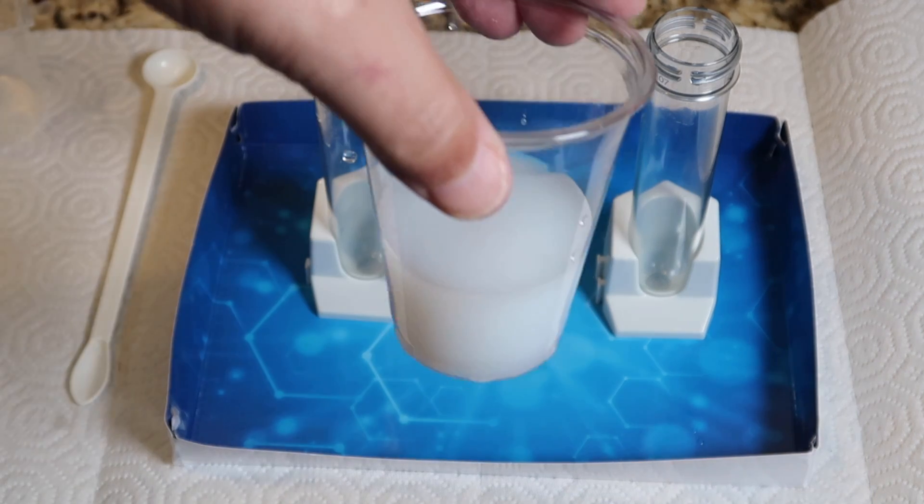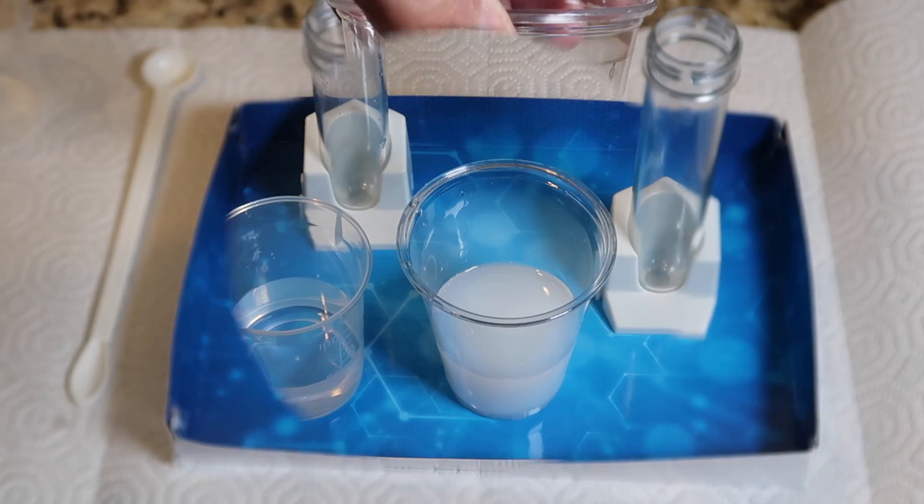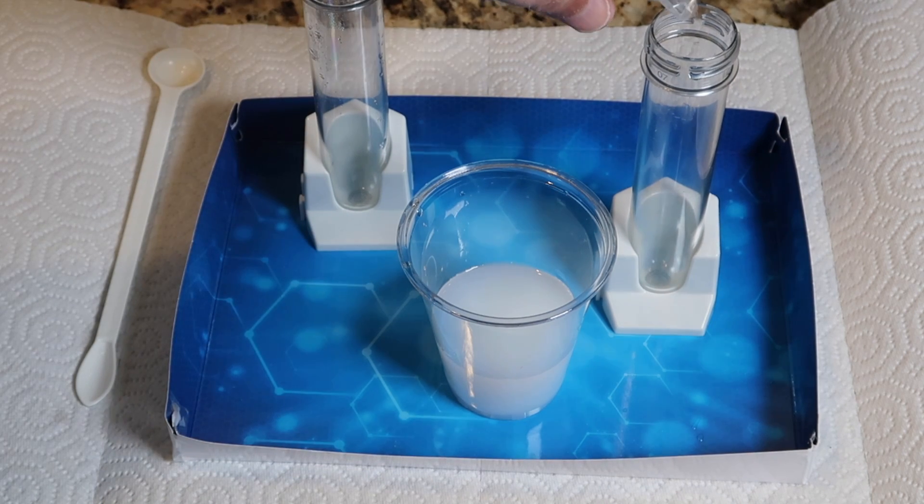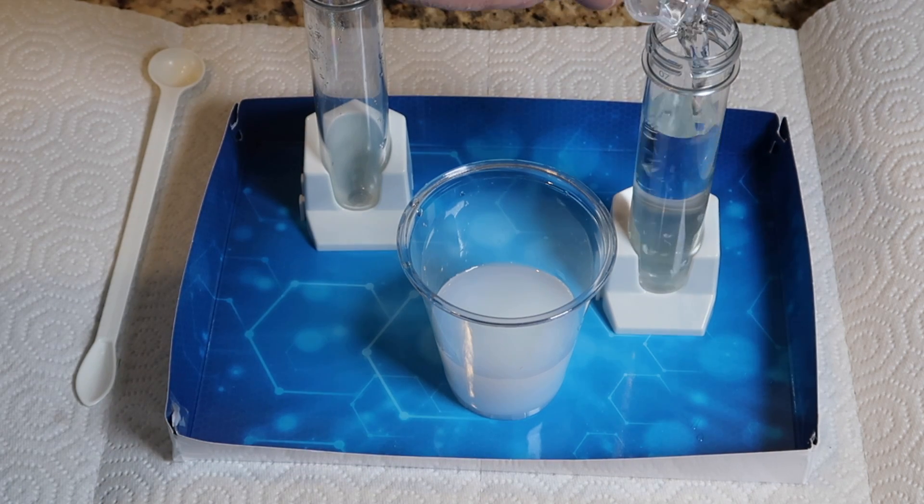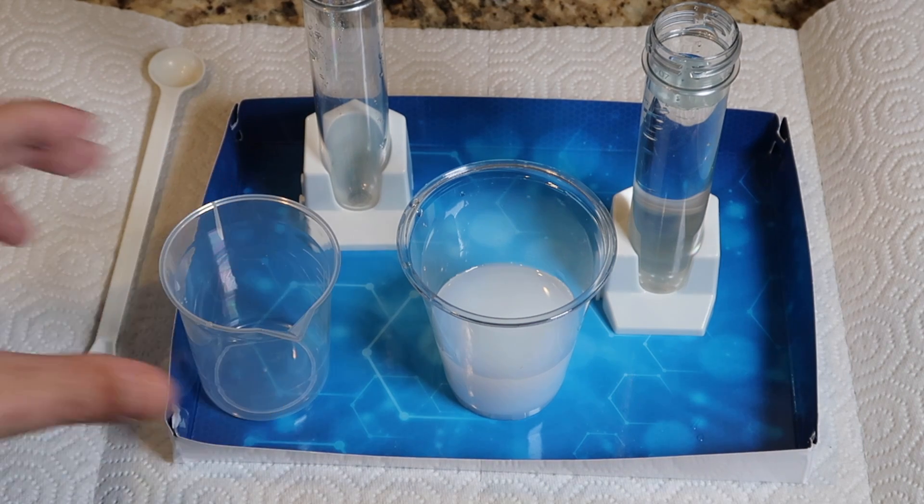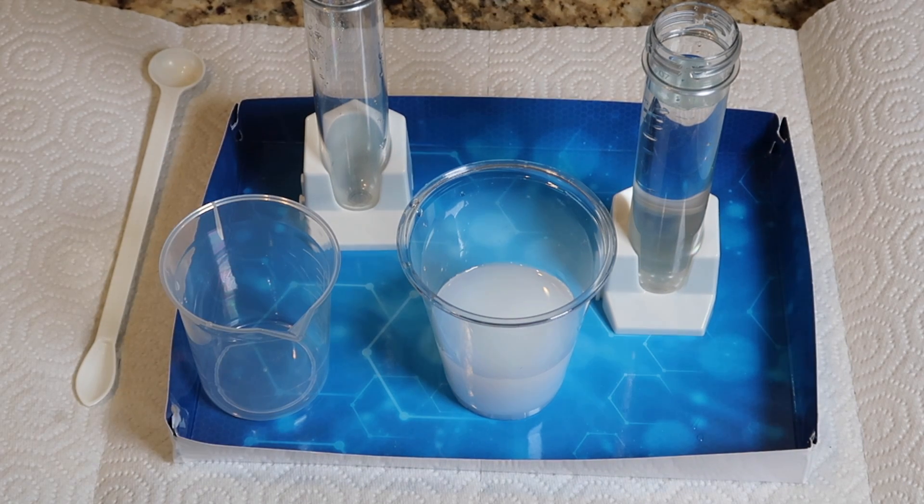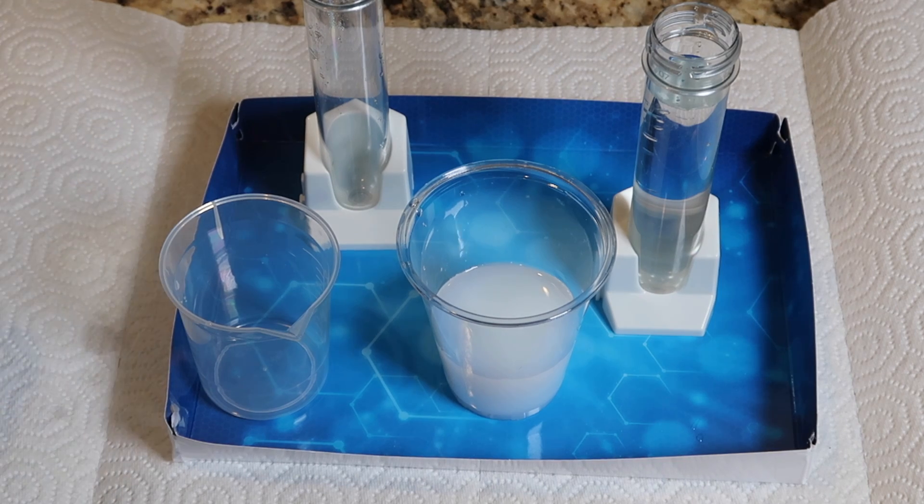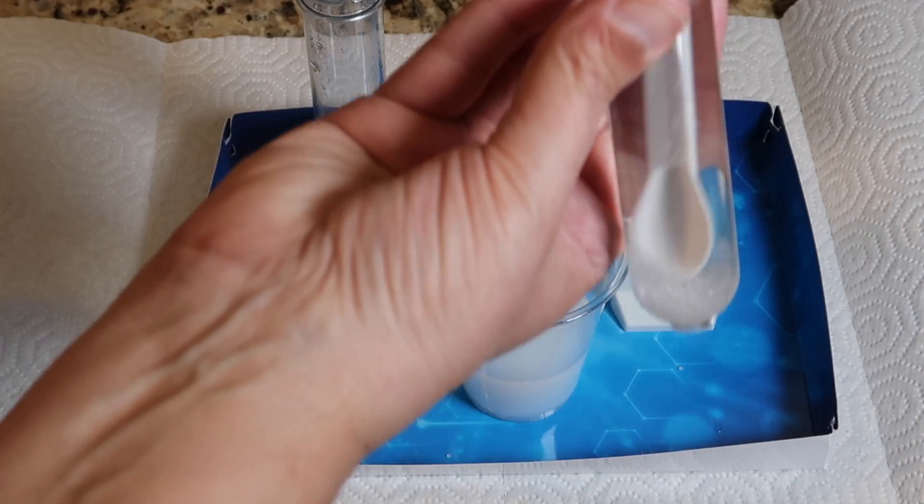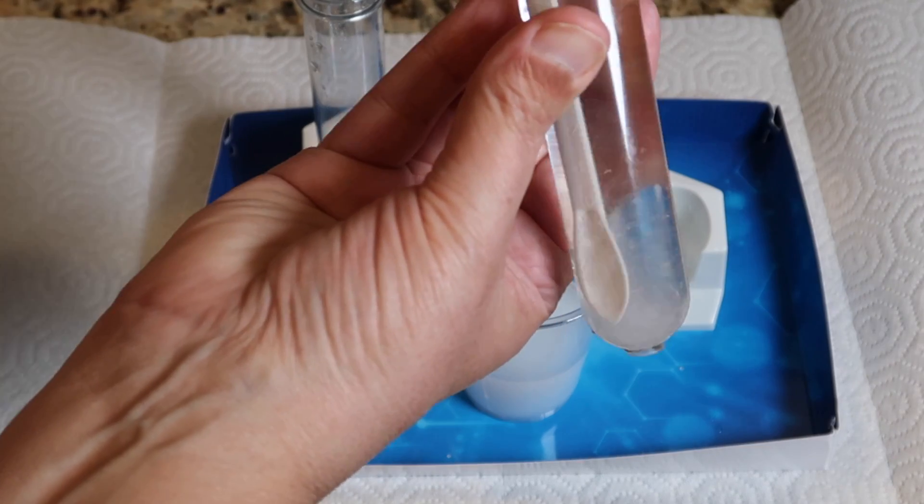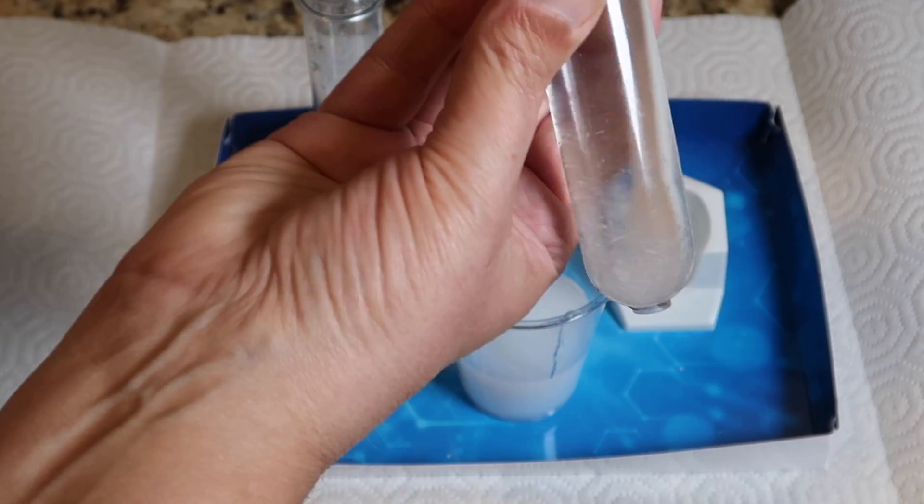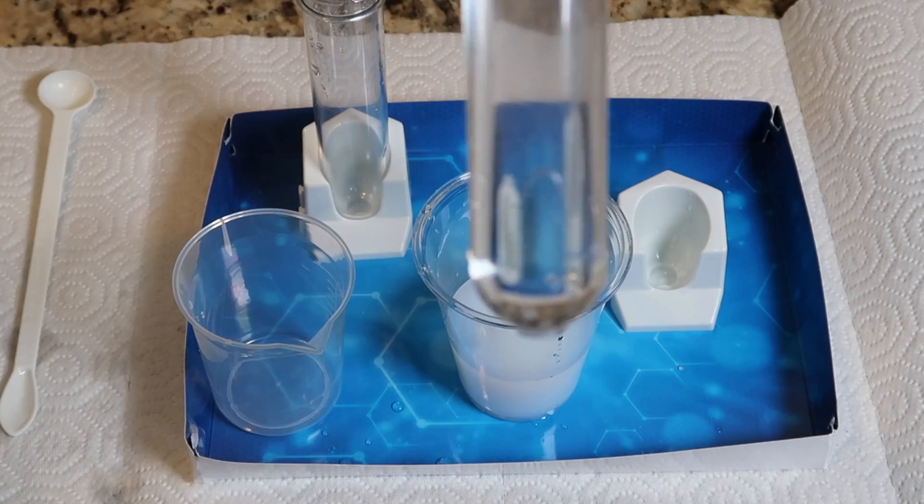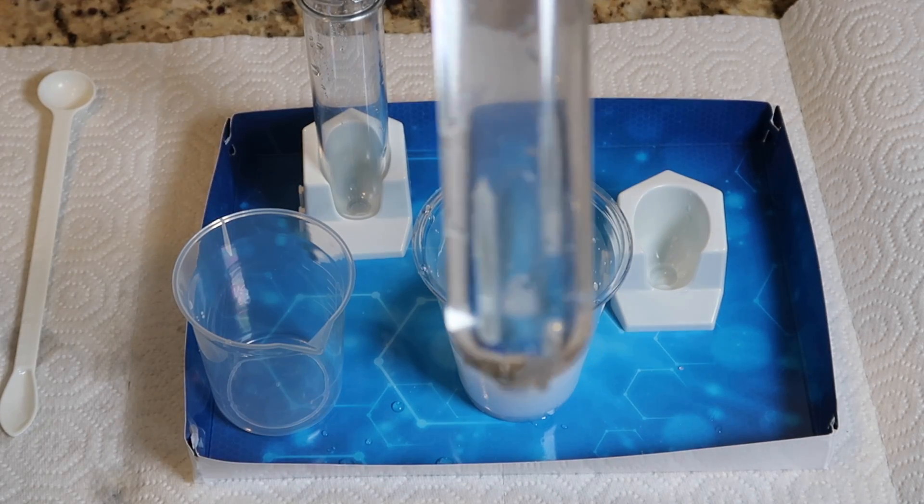And that's exactly what we get. Now we take 50 milliliters of water into the second test tube, into which we're going to dissolve a large scoop of citric acid. It's definitely harder to make these larger crystals fall into solution. But I think that is now a solution.